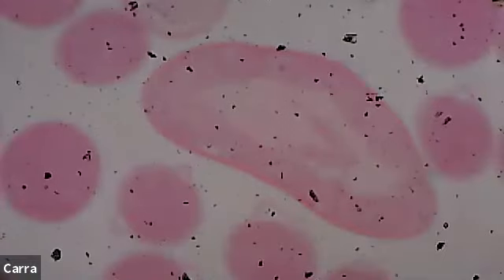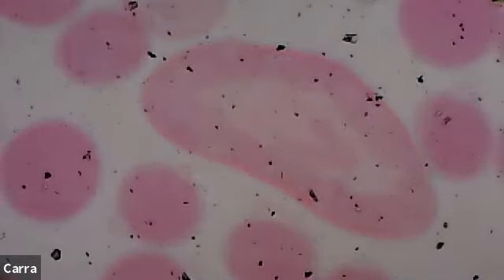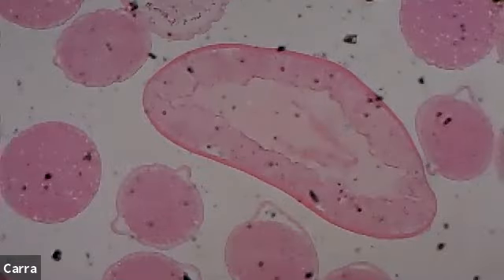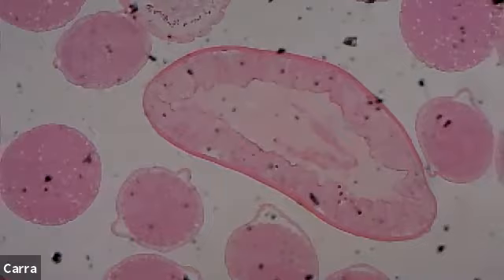All right, and hopefully we can see this whole thing in the field of view. No, we cannot, because it's interesting, just so that you know, what I'm seeing in my microscope is different than what you see. When I look in my microscope, I can see the entire circumference of this roundworm, but it just doesn't translate in the video. So I'm sorry about that.